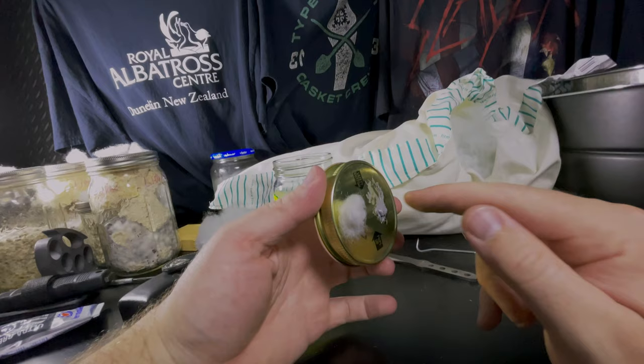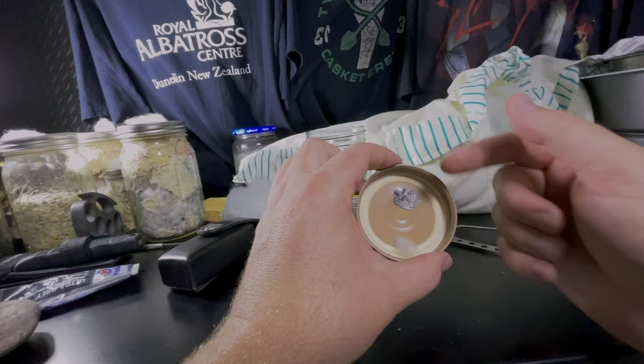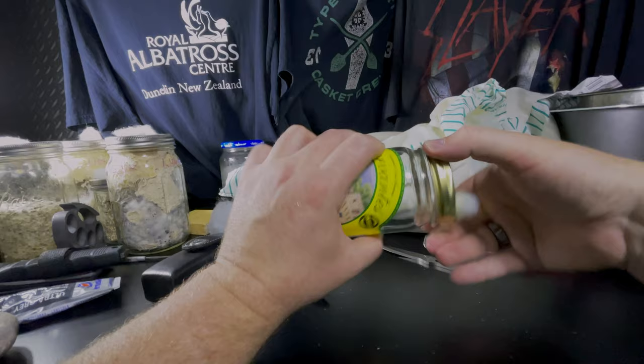It almost doesn't matter that I didn't clean around the outside or the inside, because I have continuous glue going to either side. So as it dries, it's going to form like two caps on either side of the hole and hold itself in there. And there's a brand new jar.